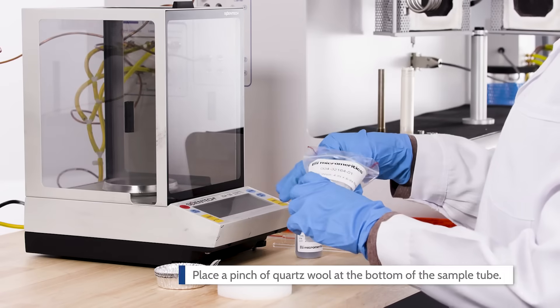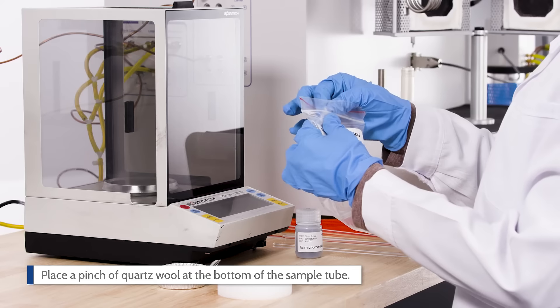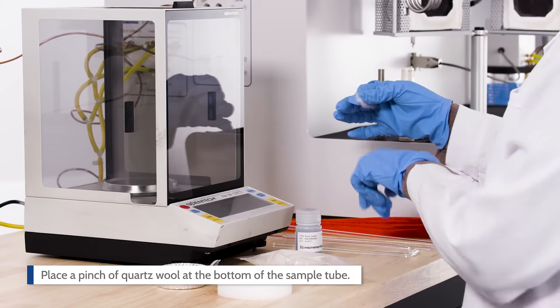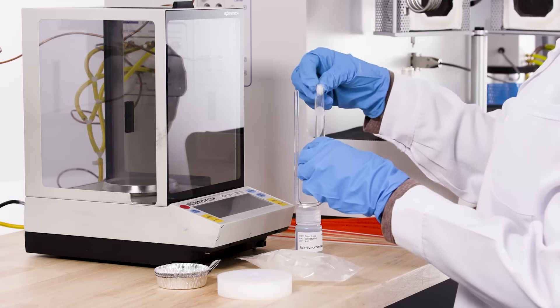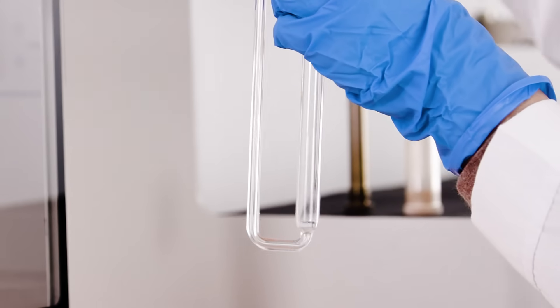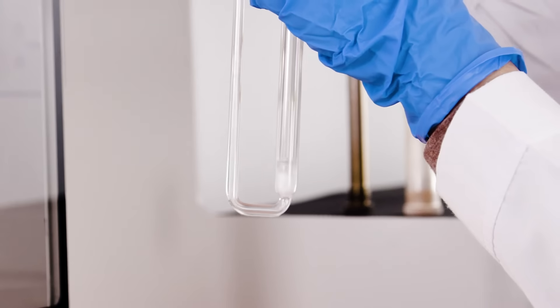Before loading the sample, place a pinch of quartz wool at the bottom of the sample tube with the provided glass rod. Be careful not to compact it too much to prevent pressure buildup during analysis.